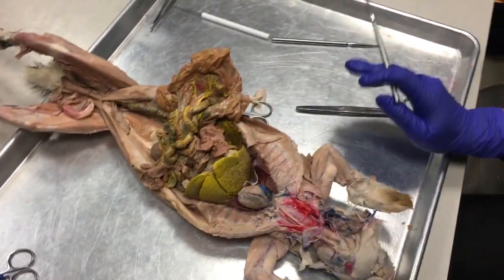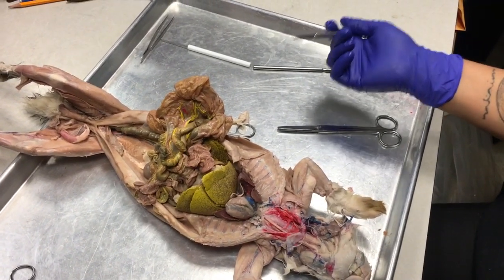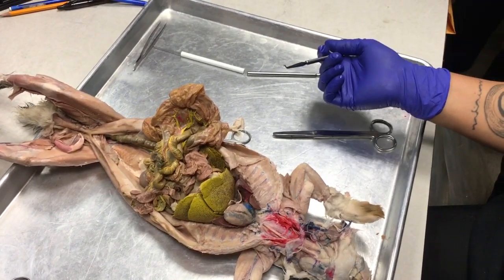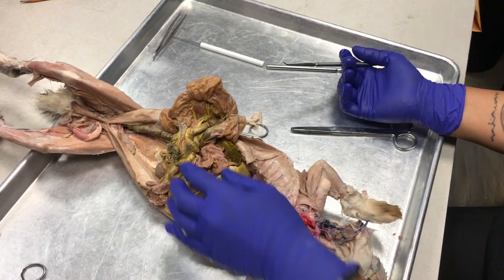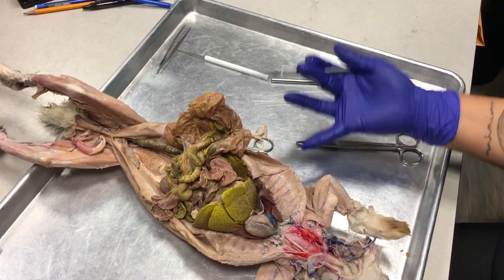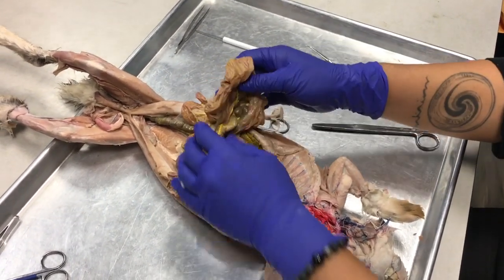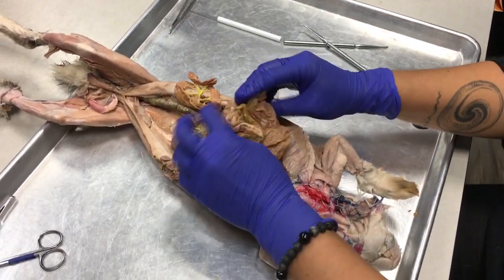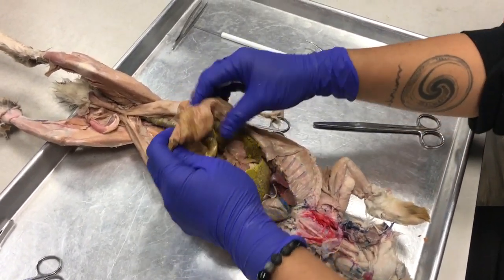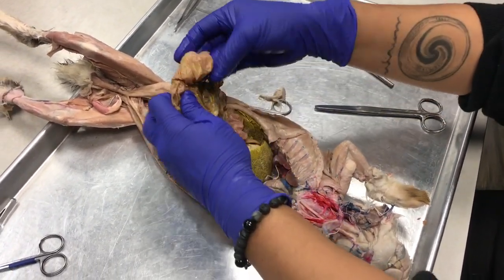So when an animal is a vegetarian, they have fibers that are difficult to break down into nutrients. It's a very inefficient type of food source, and they need a ton of intestine in order to break it down and get nutrients. So that's why the intestines are so gigantic. Okay, so look here. I have all of this intestinal stuff.